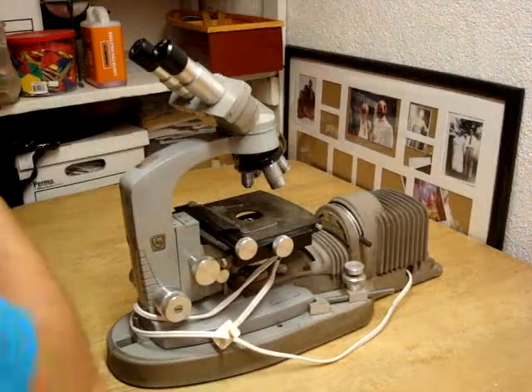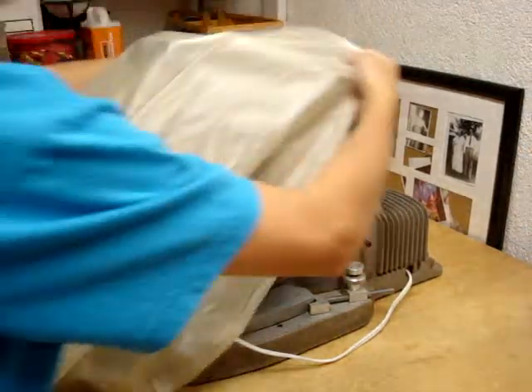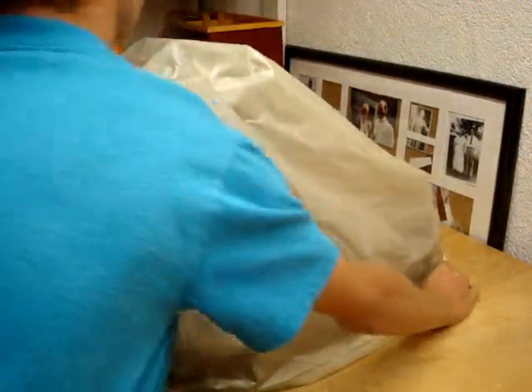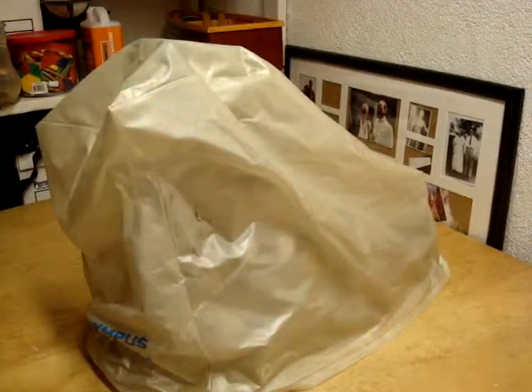Make sure this is centered and then put the cover back on. And that's it.